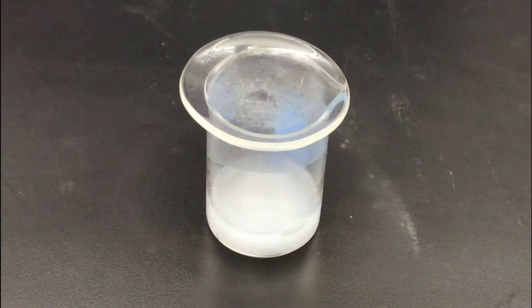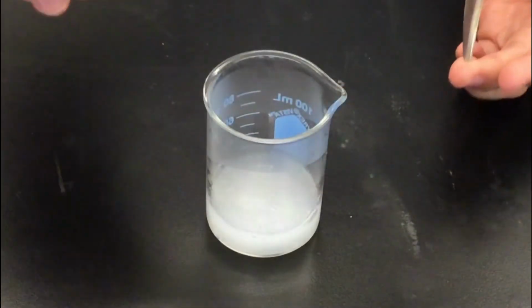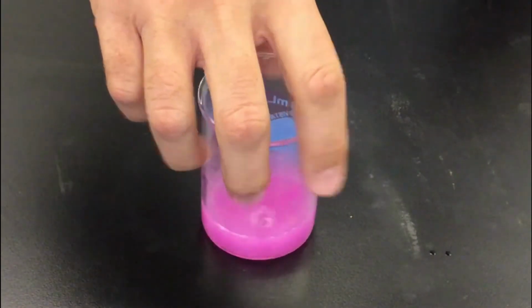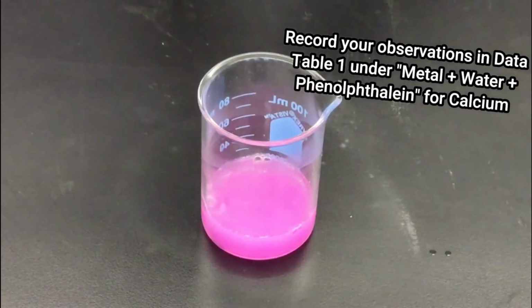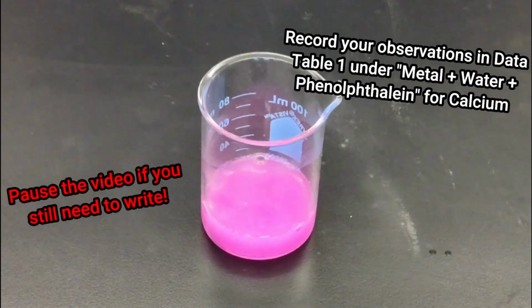Just like with the magnesium, we're going to now add some phenolphthalein to test for the presence of a basic solution, and that will indicate whether or not we have an alkaline earth metal reacting with water. See a very dark pink color there? Remember, that's an indicator that we have a basic solution, and therefore for us that indicates a chemical reaction. So that supports all the evidence that we've seen so far.